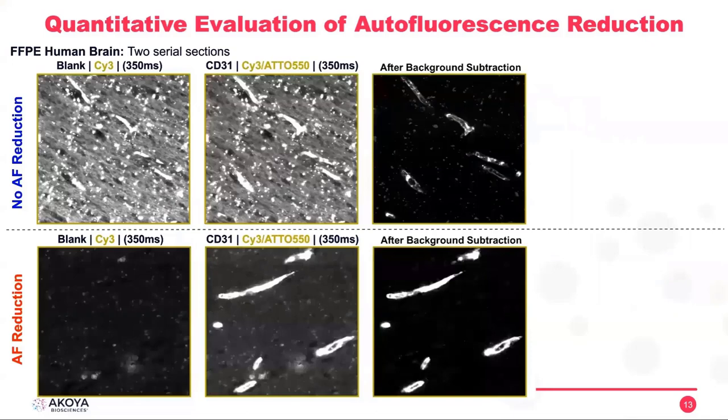So now we are looking at the same tissue, but with a different antibody and a different channel, which is CY3. What we are seeing here are the blood vessels. As you can see in the blank image, the inner part of the blood vessels has high autofluorescence. And then again, when we do background subtraction, we still can extract those blood vessels, but you can see that there is still a lot of noise in our image. It's not just composed of those blood vessels that we are looking to extract from this image.